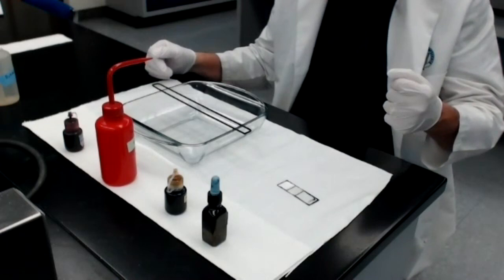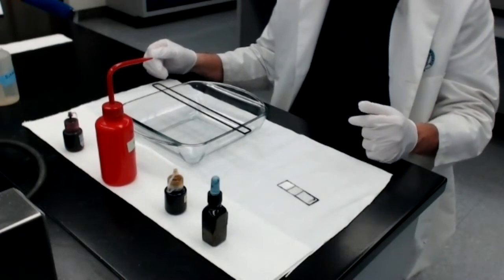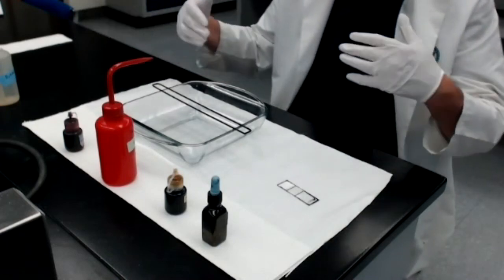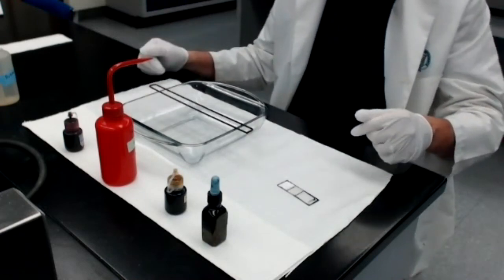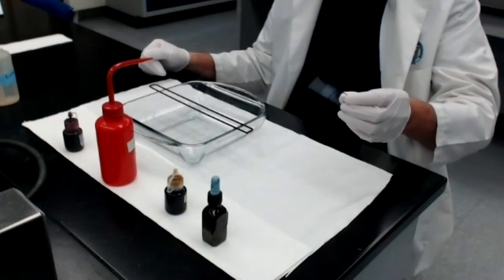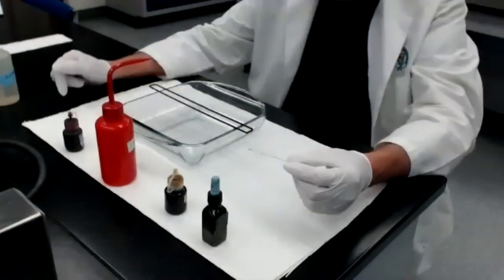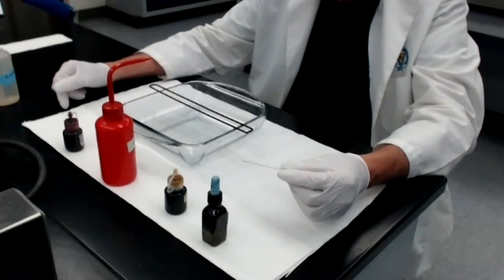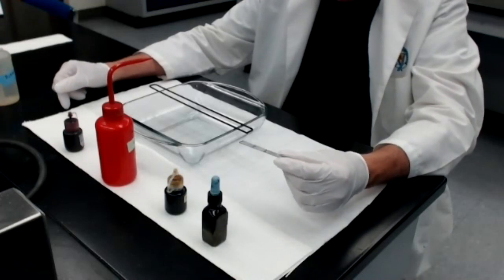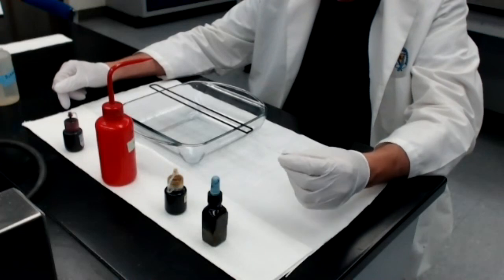Okay, so I made up a smear before I turned on the camera. Of course, I have disinfected my countertop. Everything's ready to go. I've got my staining dish. I have the rod across the staining dish, and I have my previously prepared smear. Now, what I did here is something your lab encourages you to do, and that is to mix together both gram-negative and gram-positive bacteria. And that's what I did here.